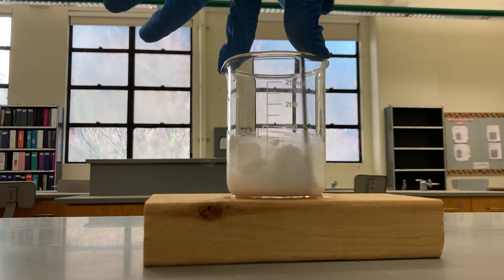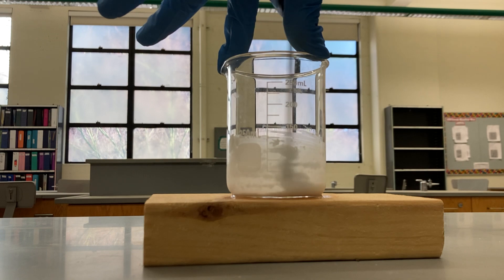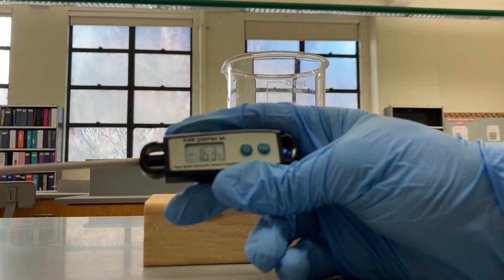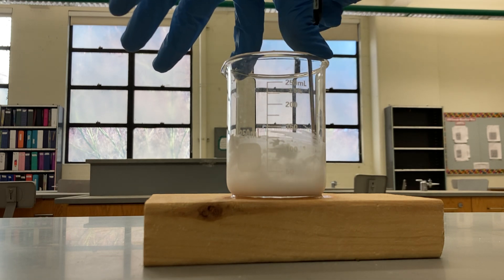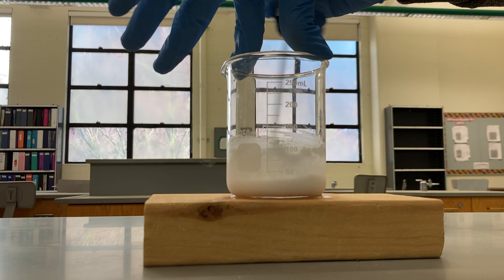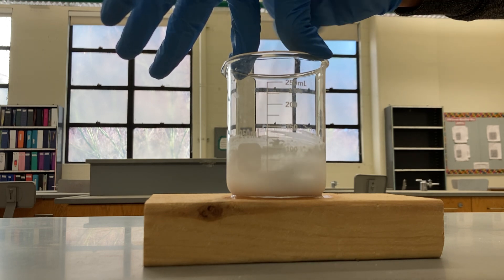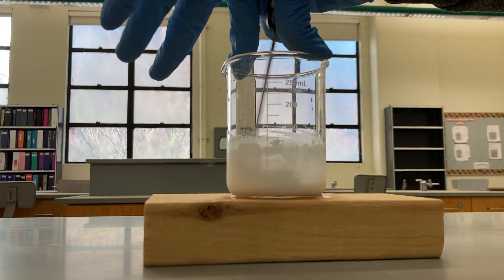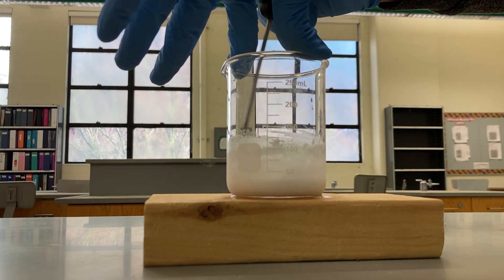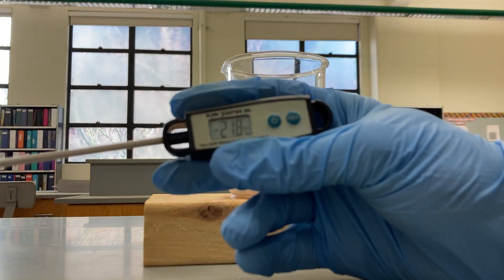Continuing to mix it. Just to pause and look at our thermometer — if you can see it right there, it says negative 16. It was actually colder than that. I'm going to keep mixing this, and now you can hopefully see that it looks like it's a liquid solution at the bottom. Right now the temperature is at minus 22 degrees Celsius.